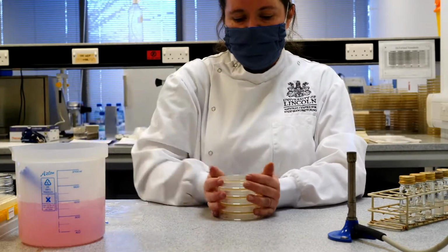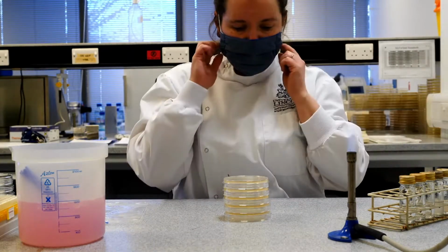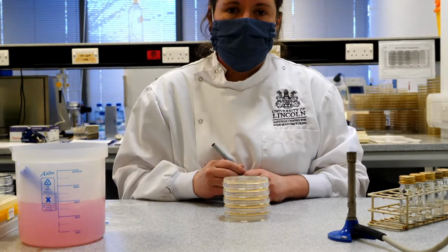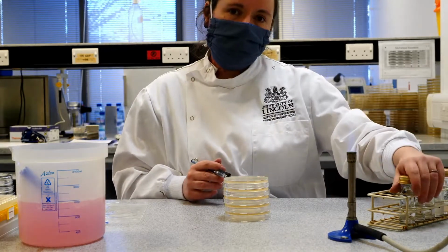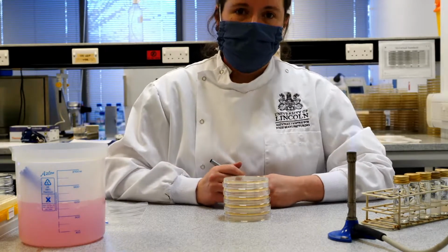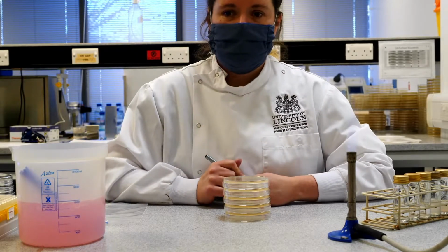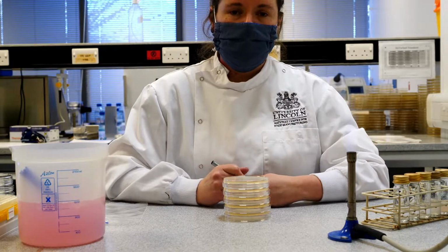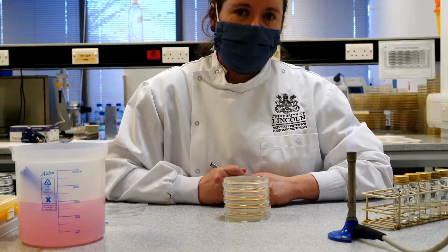And the first one we're going to use is nutrient agar. So nutrient agar is a really good general growth medium, and it allows almost all types of bacteria to grow, and quite often some yeast, some fungi as well, even though that's not what this is particularly designed for. So by transferring the liquid from our dilution onto these plates, this will allow us to calculate what is known as a total viable count, or aerobic colony count, of the food that we're looking at. And that's one of the most important counts in terms of microbiological specifications for food, as it gives us a good overall estimation of how contaminated the food product is.